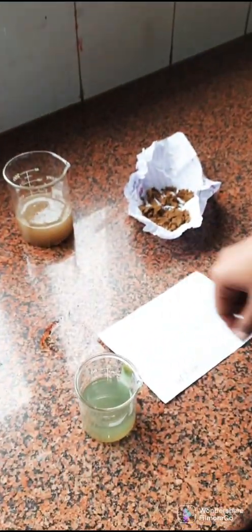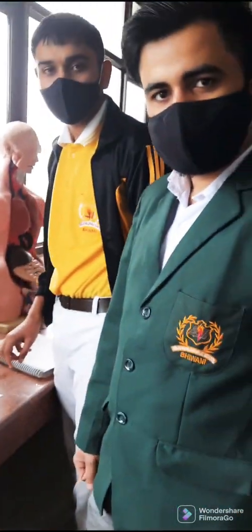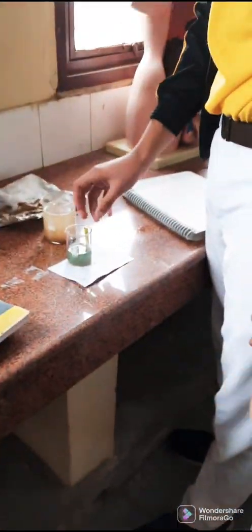The next soil sample's filtrate gave a pH between eight and nine. Group 4 — Deepak and Shivam — also took a ground soil sample, and their pH also came between eight and nine.